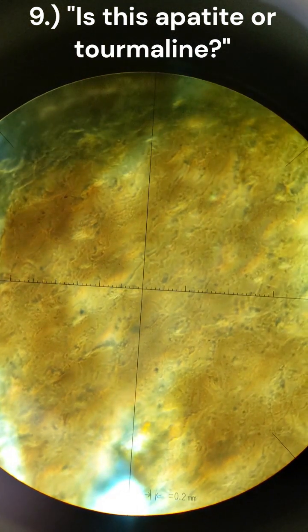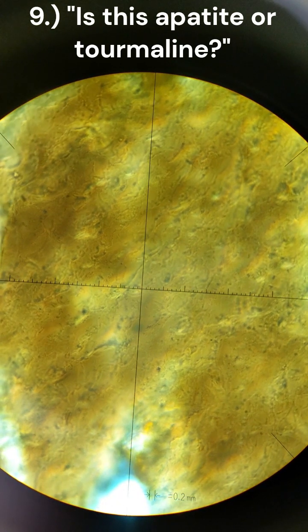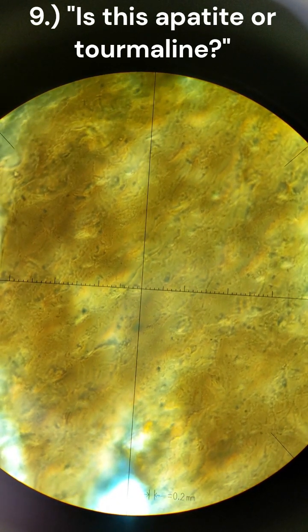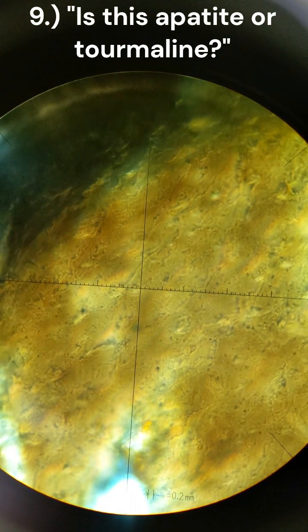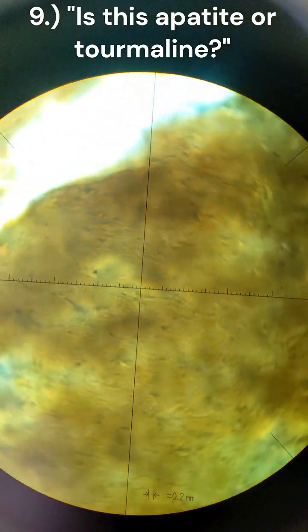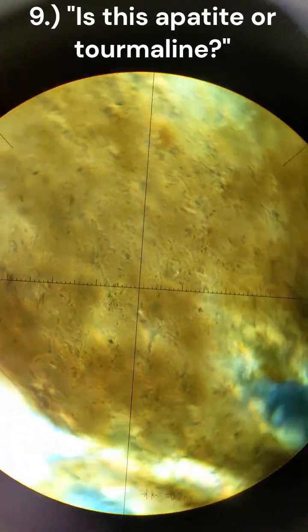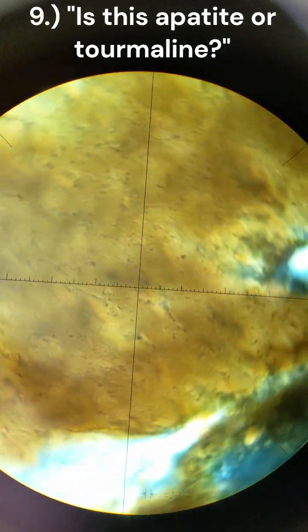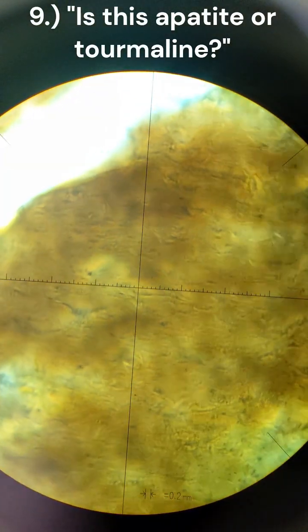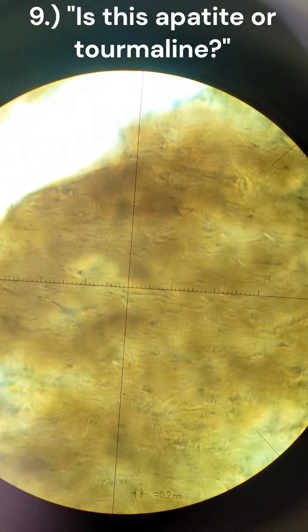So that narrows it down to apatite or tourmaline, or potentially a biotite anomaly. I don't see any bird's eye extinction within this. We are currently on XPL, and I don't know how to specify between apatite and tourmaline on this.